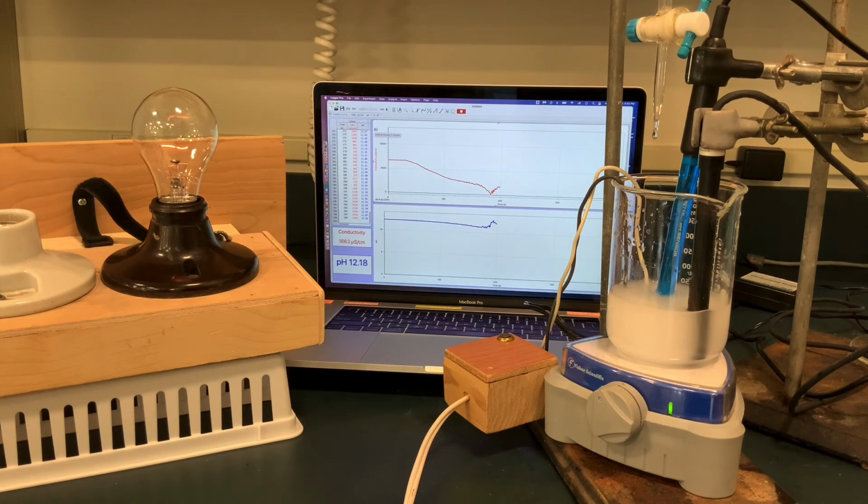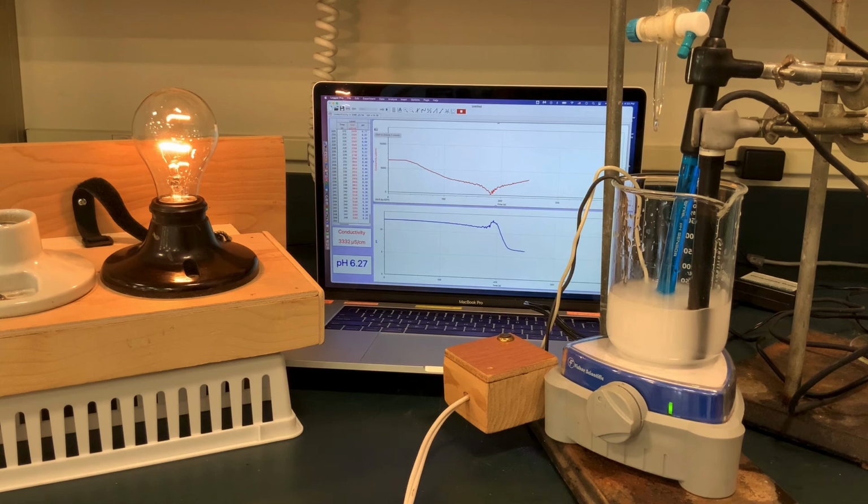It's starting to come back as the conductivity is increasing, as you can see by the graph. And now you can see that the pH graph is dropping as we would expect, as all of that hydroxide is used up, and now we've got excess incoming sulfuric acid. Also, which is what's obviously causing the light bulb to turn back on and our conductivity to increase.